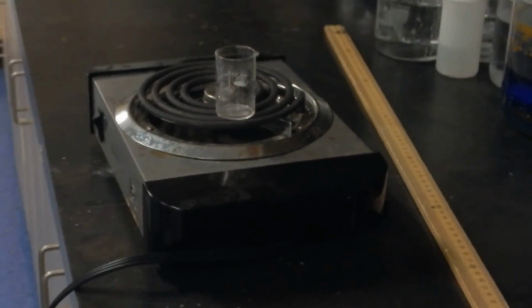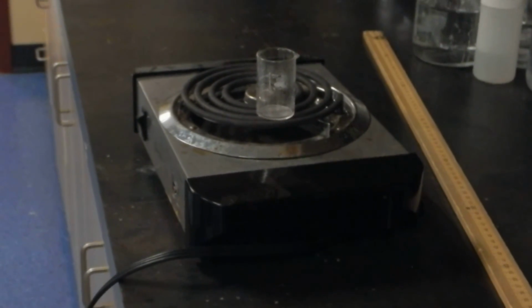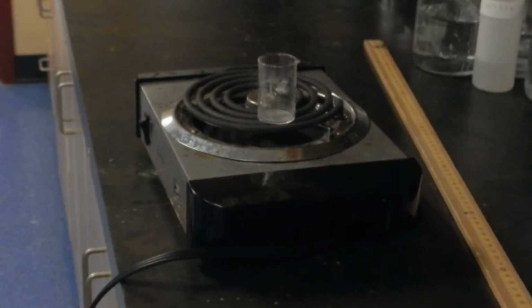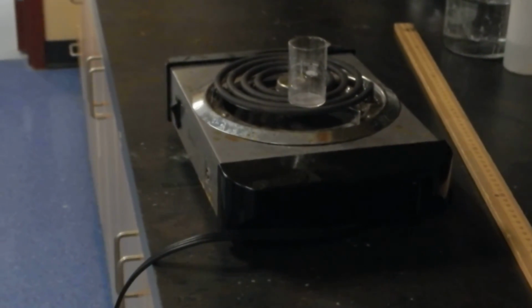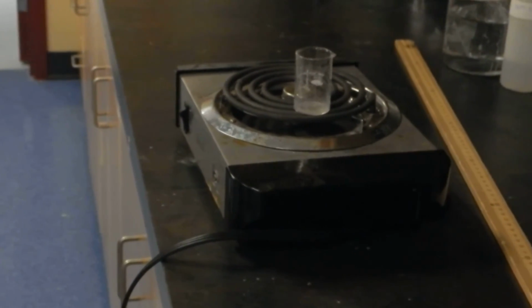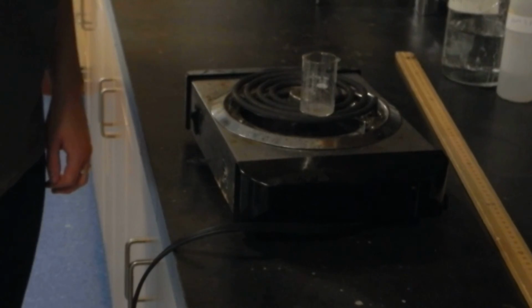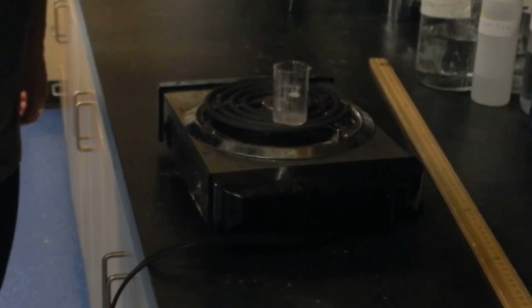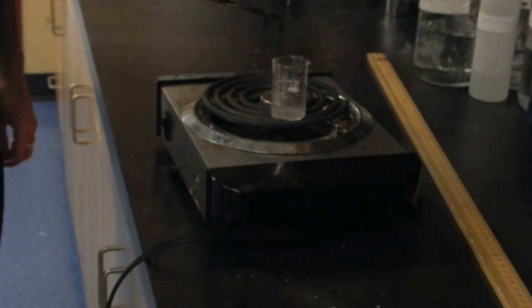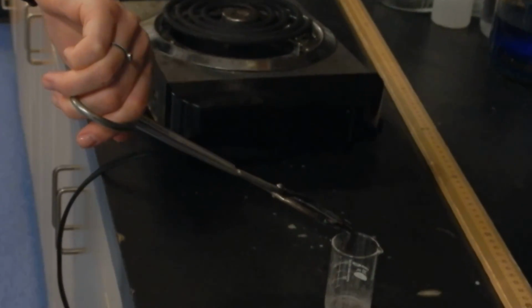So when we're done, the one lab assistant is going to take it off, put it on the counter, and the other one is going to risk life and limb and film down the top. And the lab assistant with crucible tongs has to do it just at the right time so we don't lose our baby or toddler beaker. So, liquid all gone? Okay, so that's going to just be moved off onto the counter, and the camera's just going to look down the top.